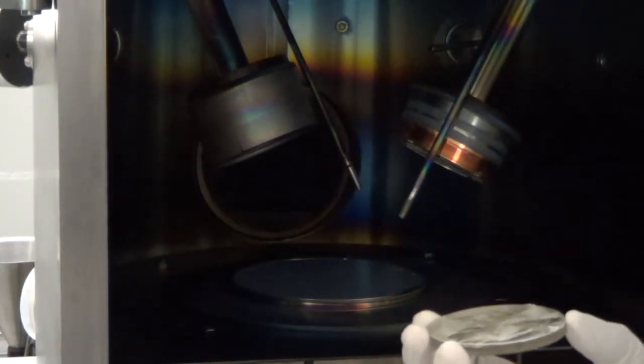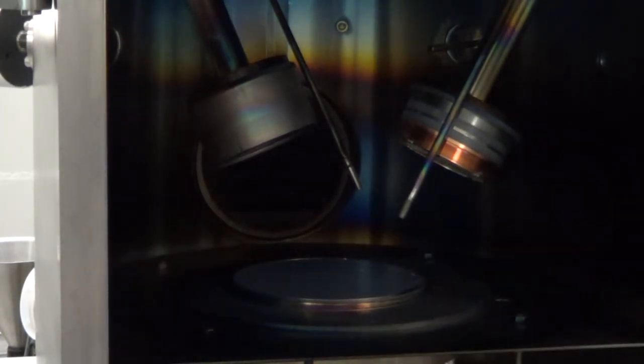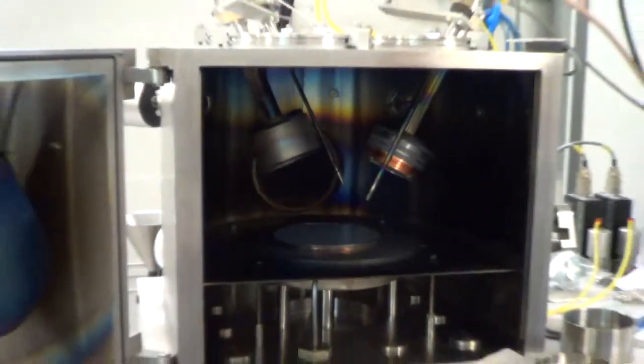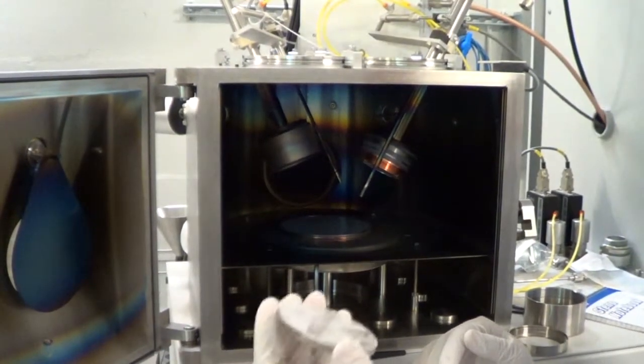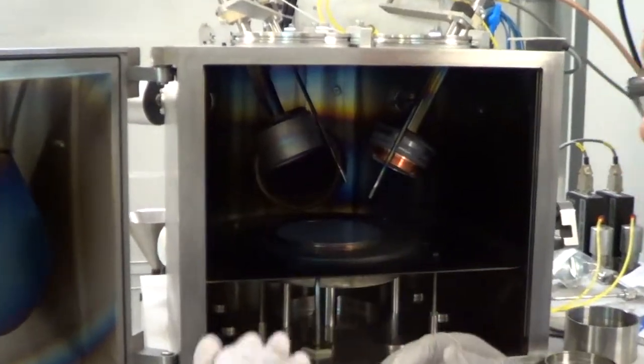So let's just put this back on and repeat the process. In the case of a target you're replacing, what you do is put on new solder. In this case, I'm just going to reinstall it to show you how to do it. So assume this has new paste.